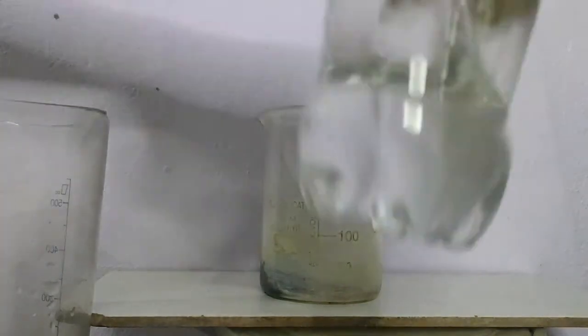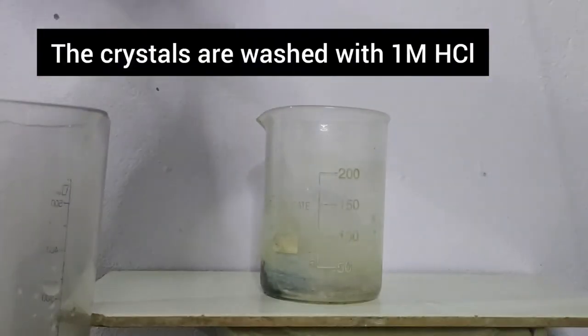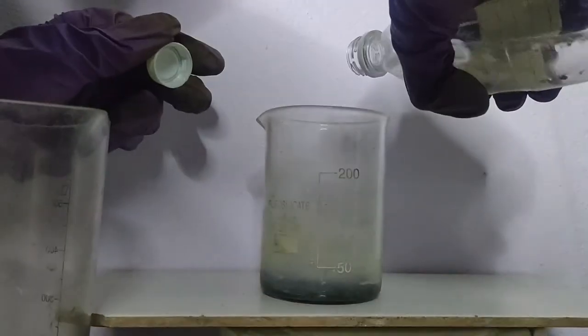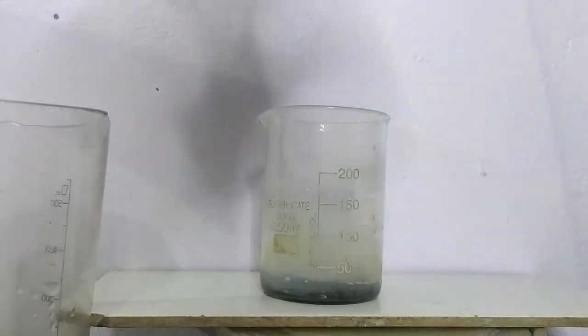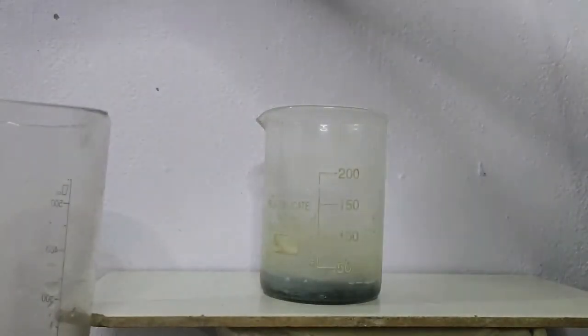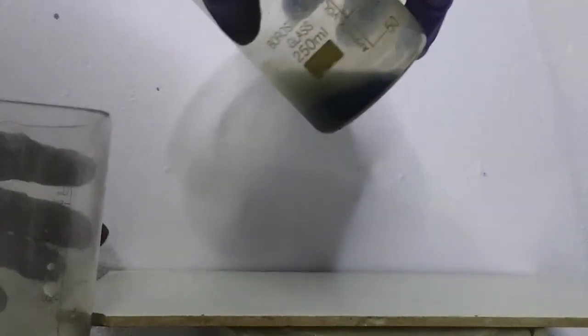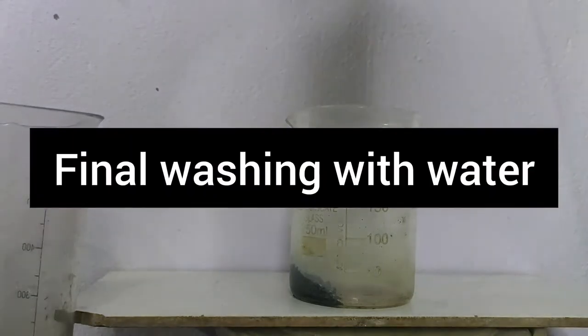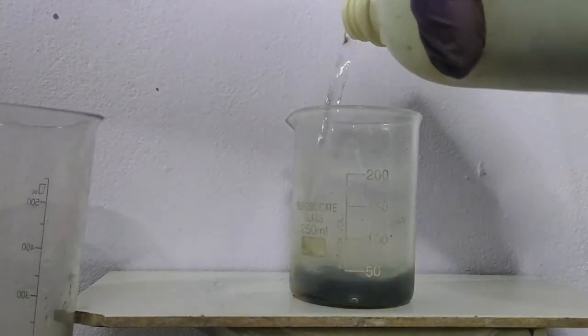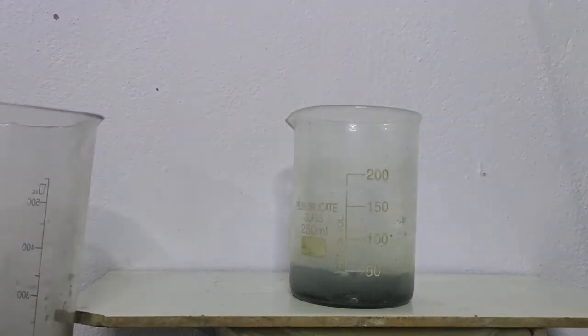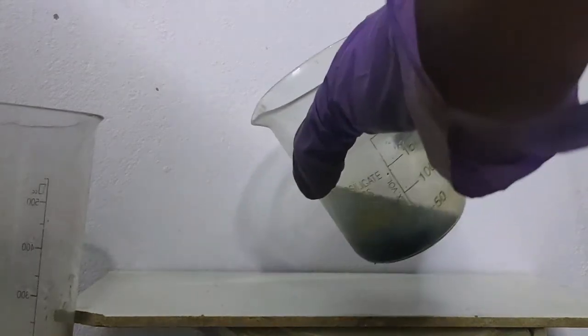The crystals were first washed with water and 1 molar hydrochloric acid. And the solution was decanted off. Now, we will wash it with water. The powder was finally washed with some water and the solution was decanted off.